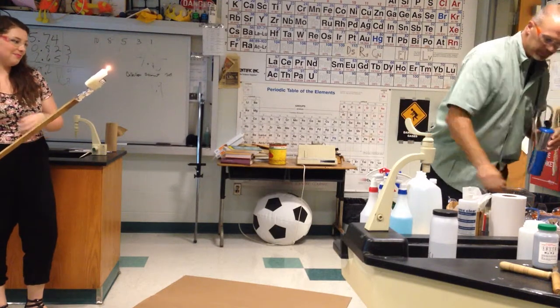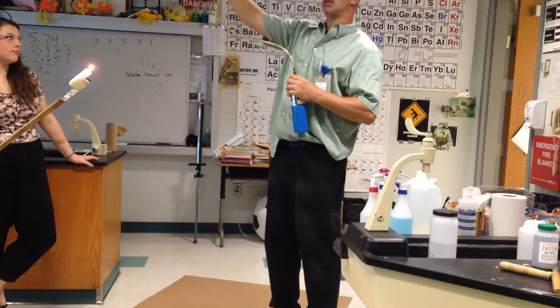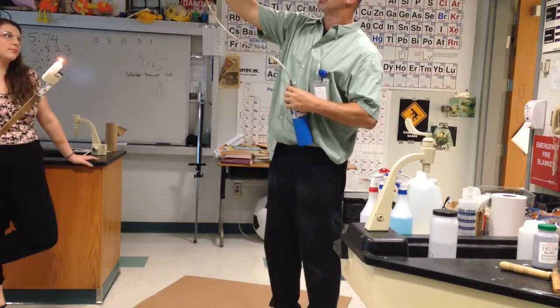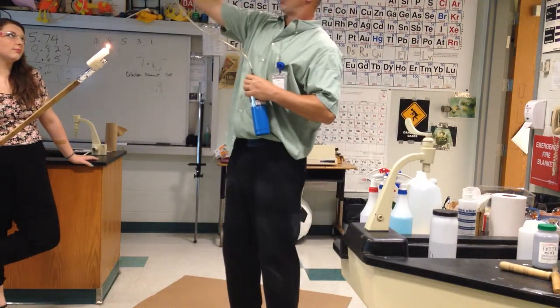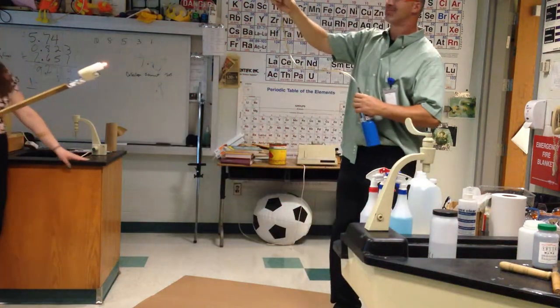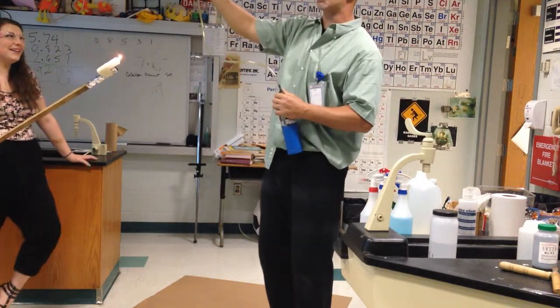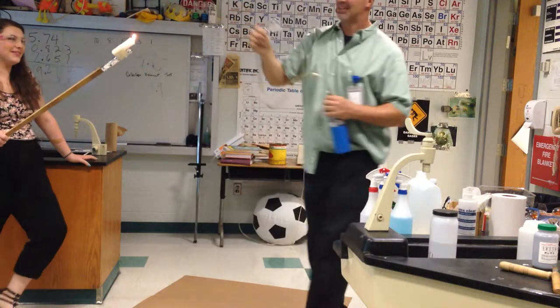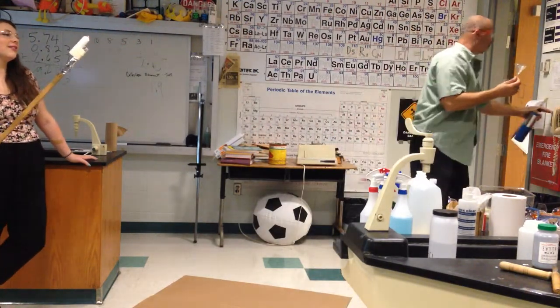Here comes some propane and we're going to make a propane bubble. We're going to test for its flammability — its ability to react with oxygen. So what could you say in terms of flammability?